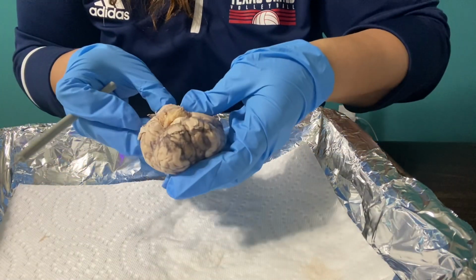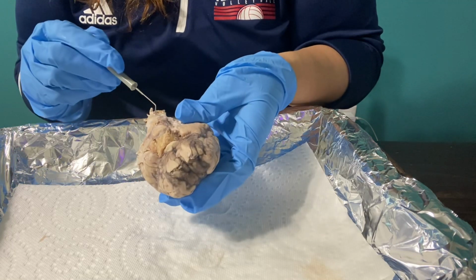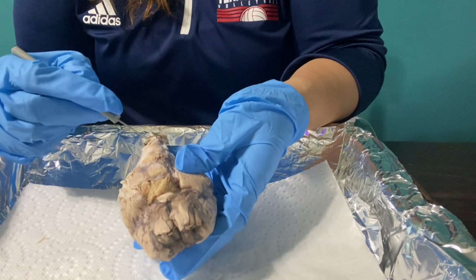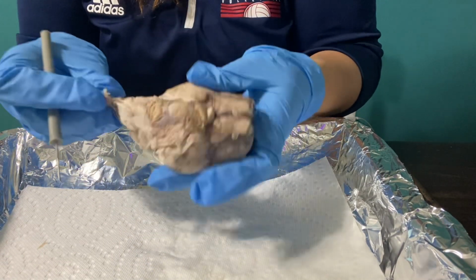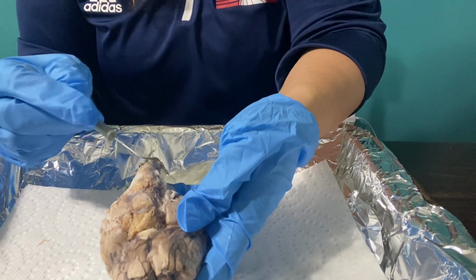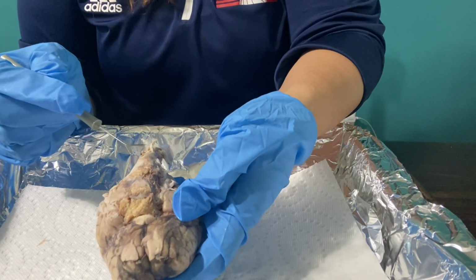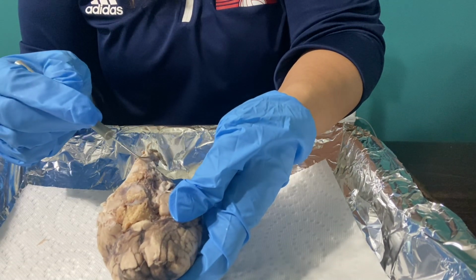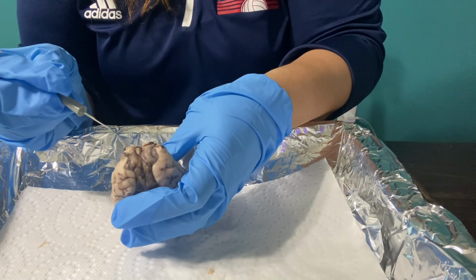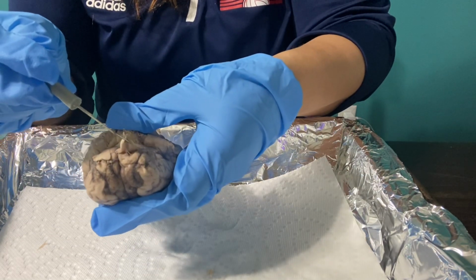Okay, all right, let's continue. So we stopped at the cerebellum. So now I want to talk about the pons. I'm sorry, we were at the pons. Let me continue this way. Here I'm going to talk about the medulla oblongata, which controls the breathing and the heart rate and the involuntary movements.